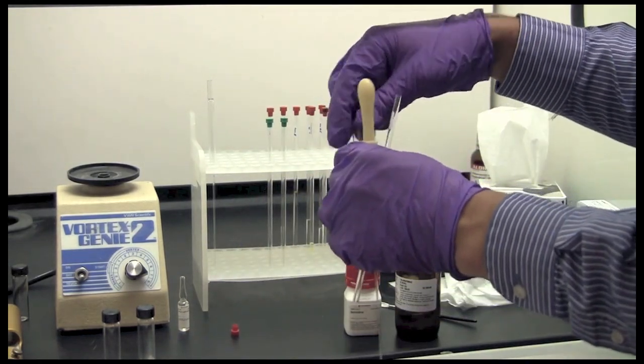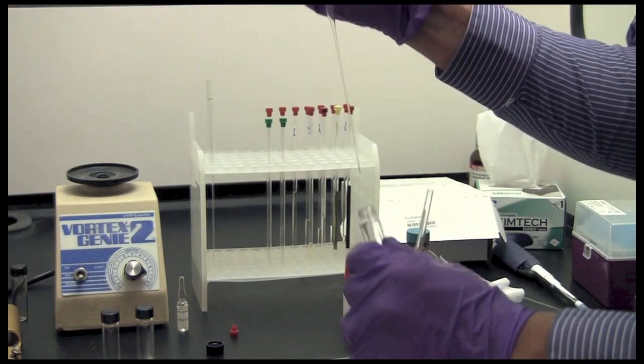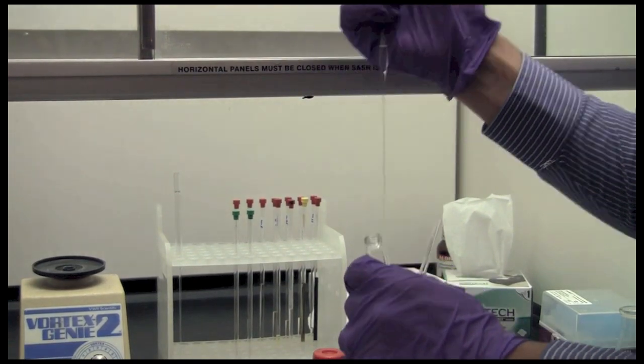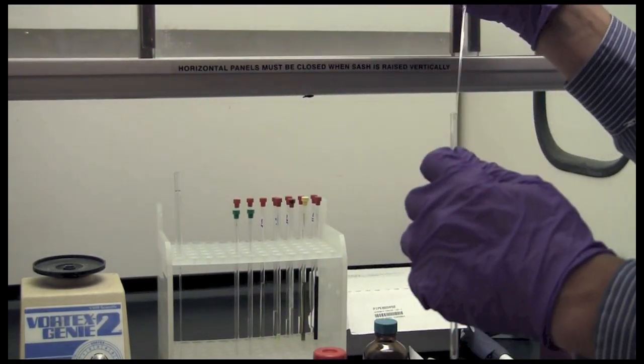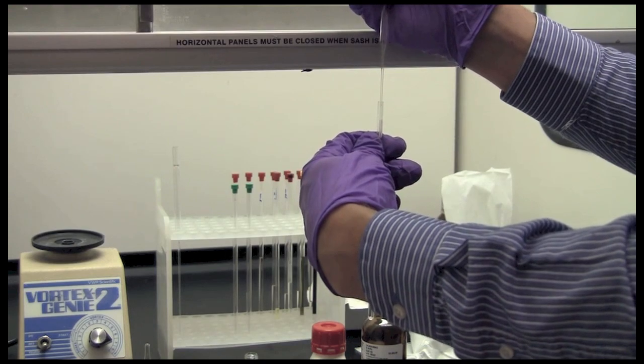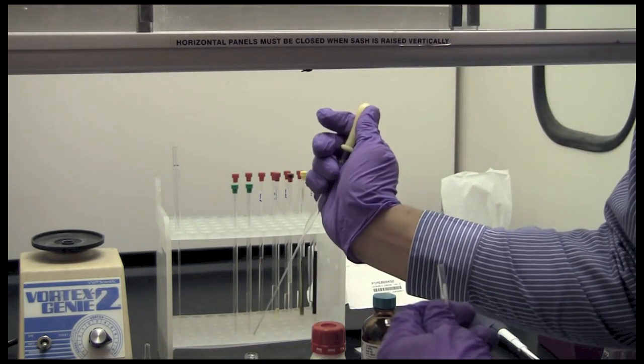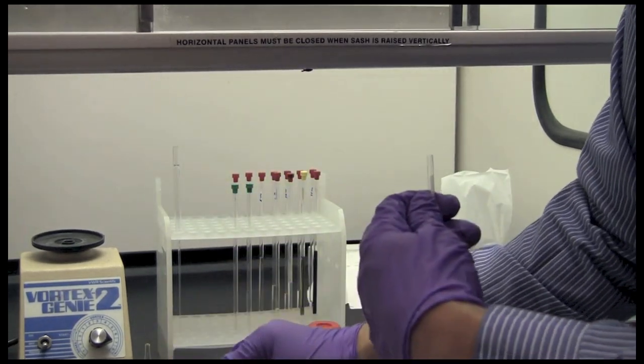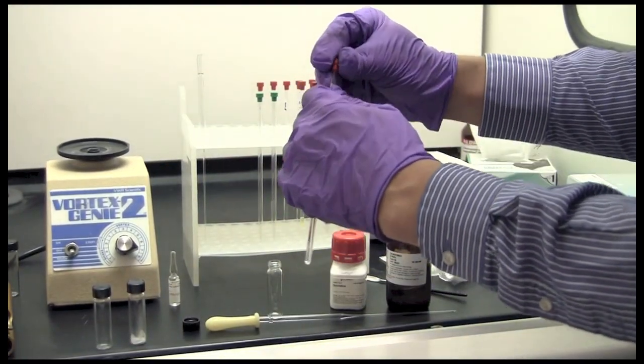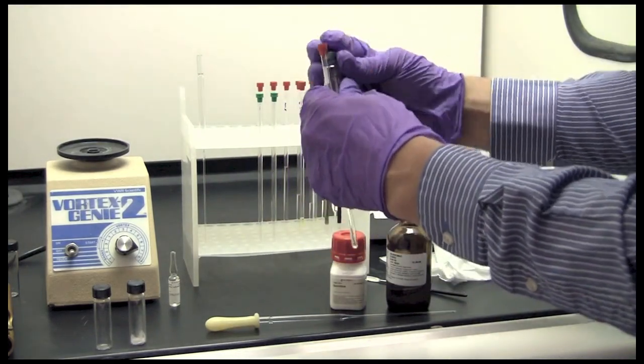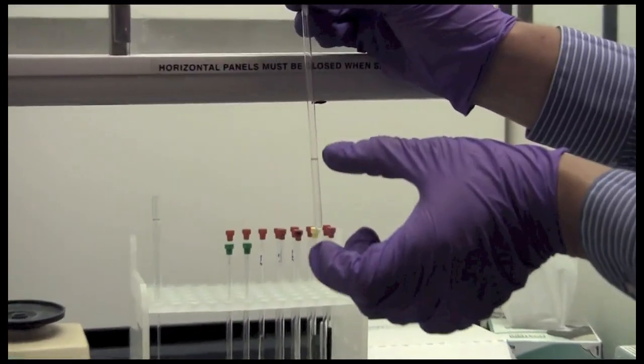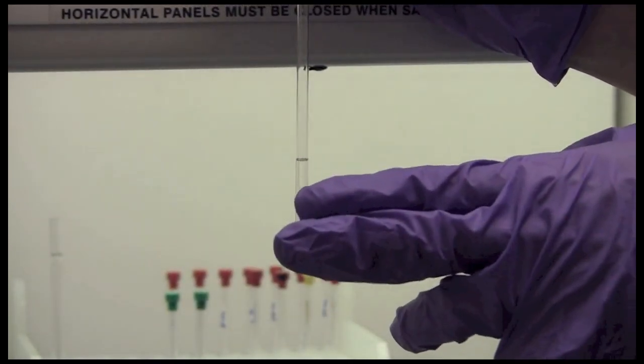Okay, so now that the sample is dissolved, I am going to pipette up the material. If you have solids on the bottom, be careful not to suck them up. And then we are going to put them into the tube. Put any remaining solvent back into the vial. Put the cap on the tube. This is a reasonable amount. Somewhere between, some people use a rule of thumb, two fingers.